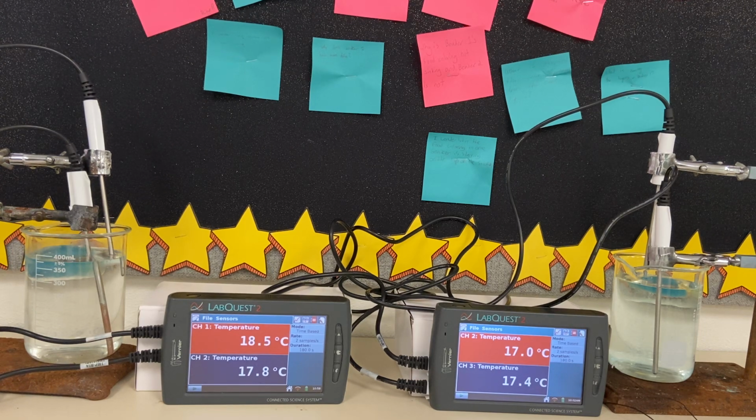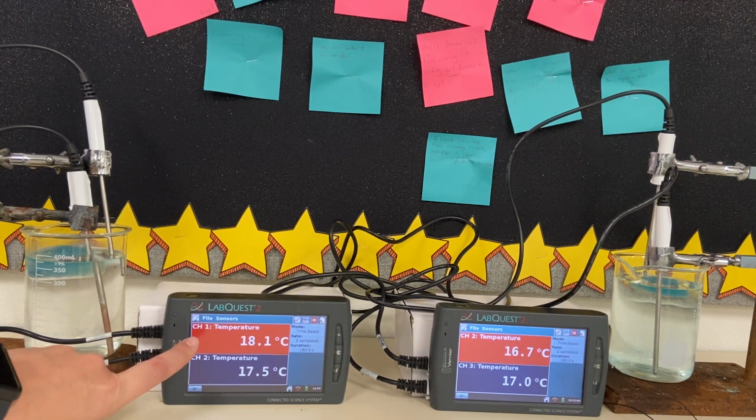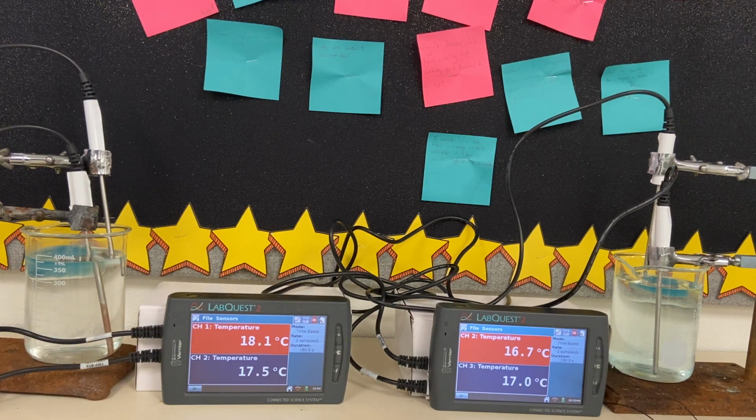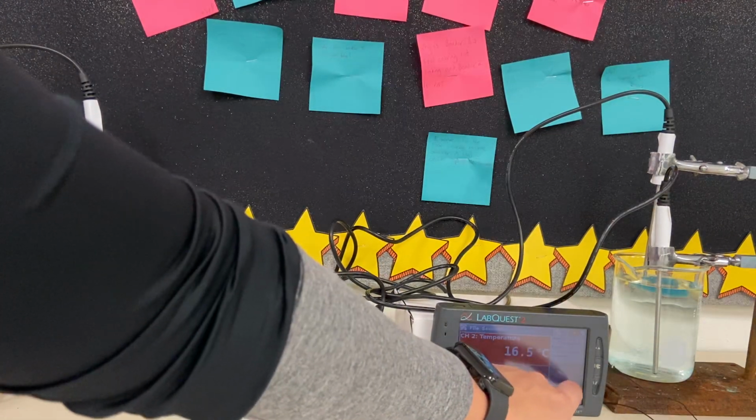At this time, I want to make sure that I clarify. I was incorrect about the temperature probes for beaker 1. So over here on beaker 1, this bottom temperature is going to be the top part of the solution's temperature, and the red channel is going to be the bottom part of that solution's temperature. So make sure that you adjust any labeling that you need while you're collecting your data, because I had those flip-flopped.